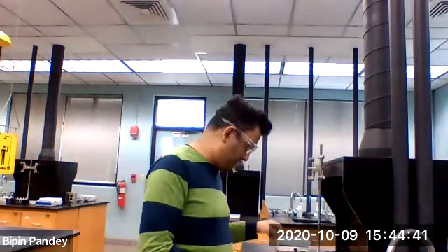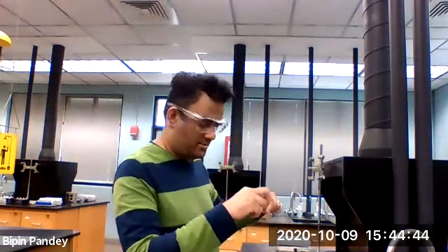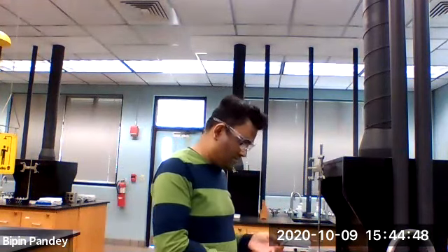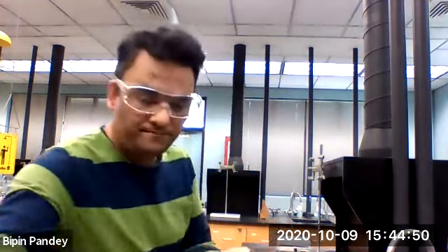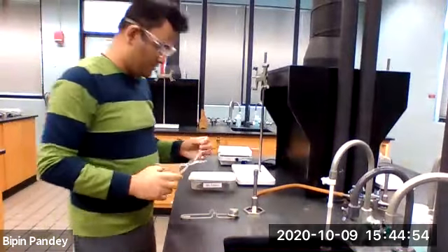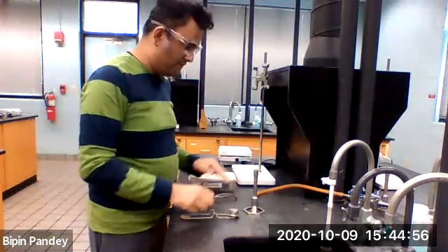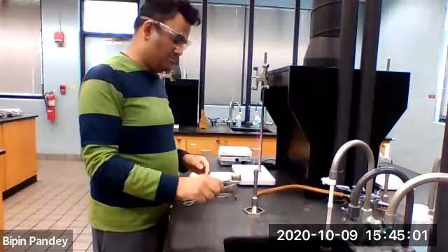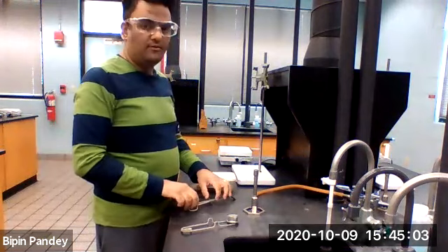I will take a piece of magnesium ribbon. I have a piece of magnesium ribbon. So you guys, I light the burner and heat my magnesium wire.